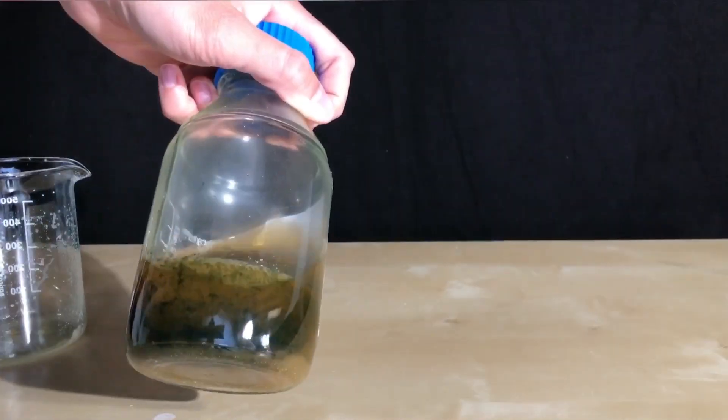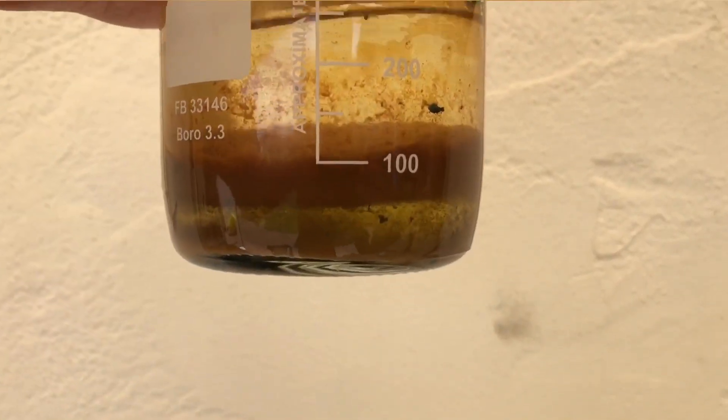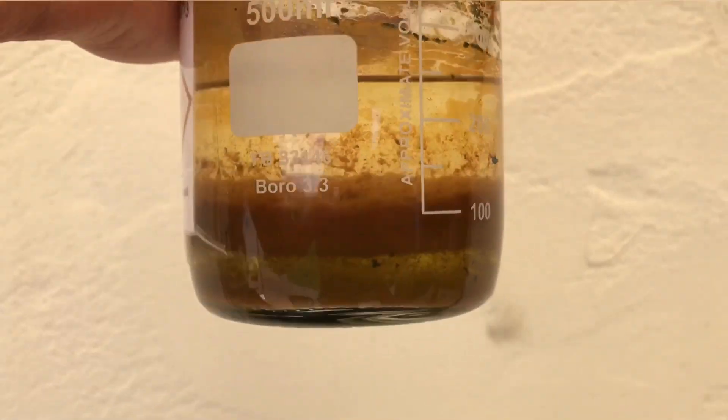The iron 2 sulfate was added to reduce the peroxide and to make it harmless. It also reacted with some of the sodium hydroxide, because you can see that very brown iron hydroxide was formed.